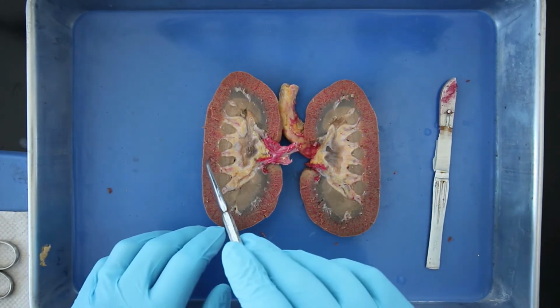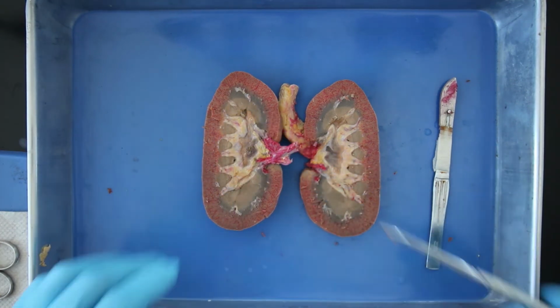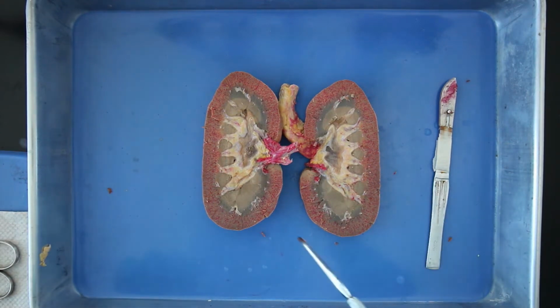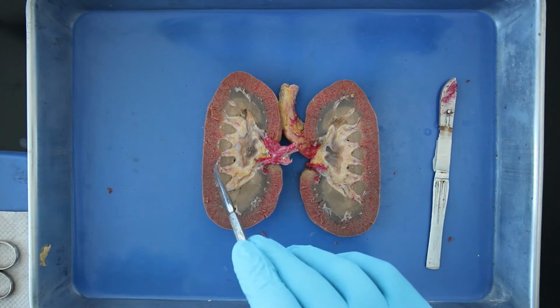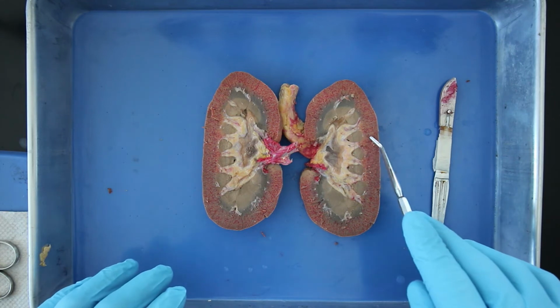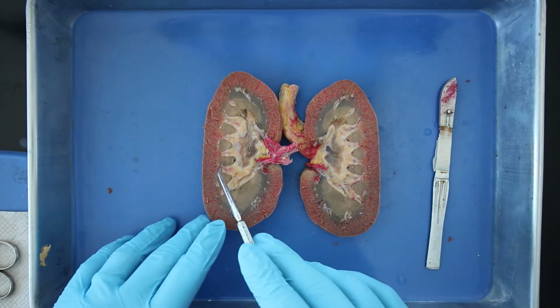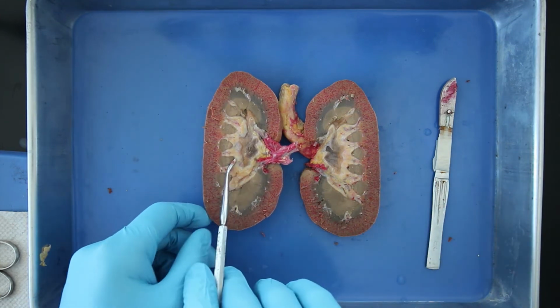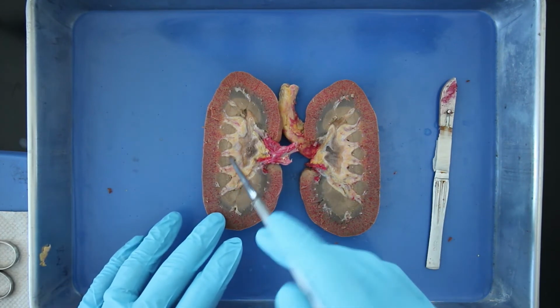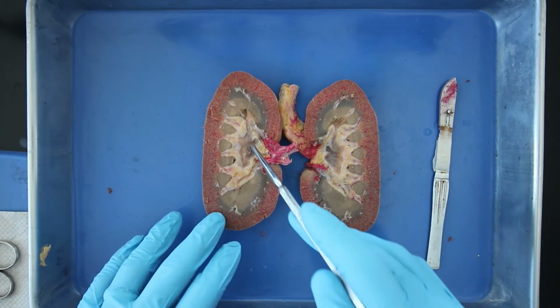As you can see, these layers don't form evenly, but in between the medulla you can see where the renal cortex extends farther past. This extension of the renal cortex is termed the renal column. The renal medulla is made up of multiple renal pyramids. This area of the renal pyramids and the renal cortex is where the nephrons are located and the filtration of waste occurs. Below each of the renal pyramids is a minor calyx, which collects the waste from filtering that is going on. Multiple minor calyces converge into a major calyx, and the major calyces converge into the renal pelvis.